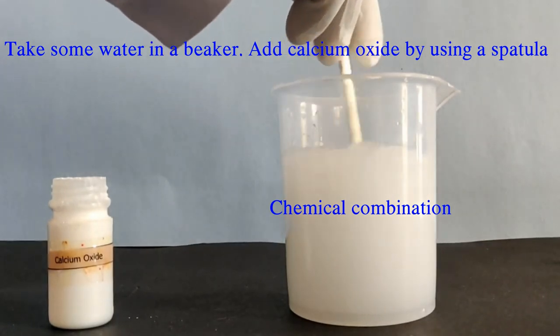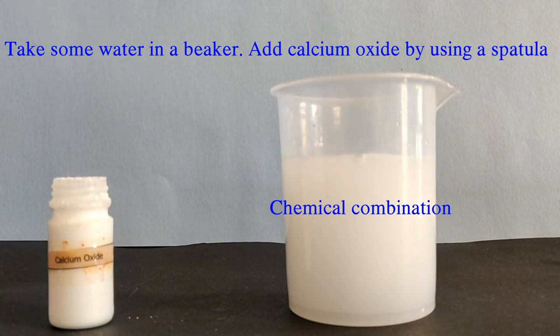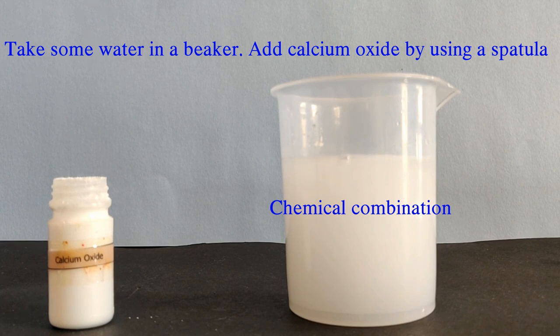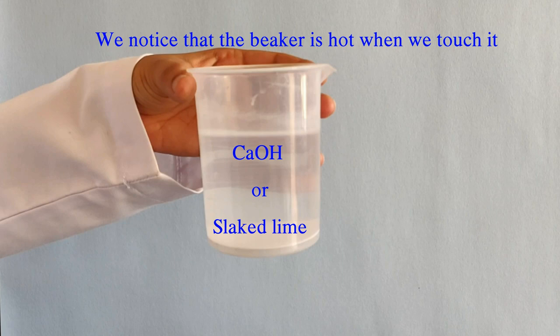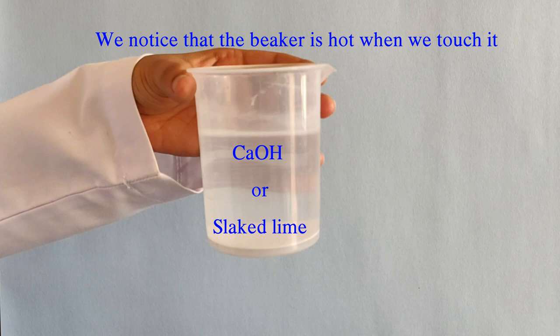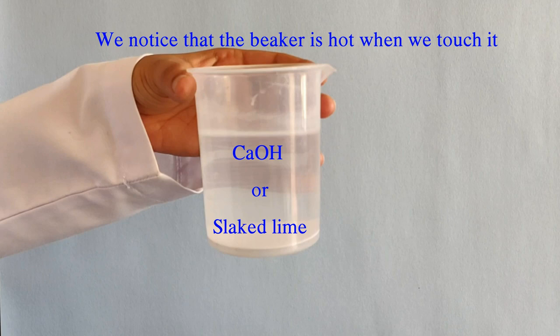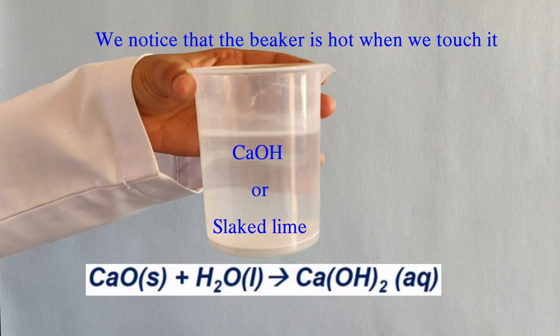This reaction is called chemical combination — we will discuss about it later. We notice that the beaker is hot when we touch it. The solution formed is calcium hydroxide, or we can call it slaked lime. The beaker being hot means the reaction is exothermic — heat is liberated.